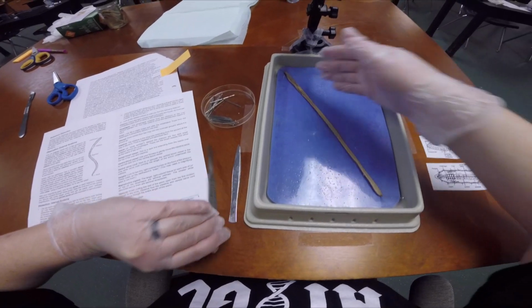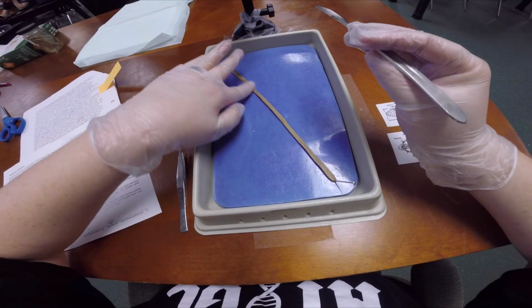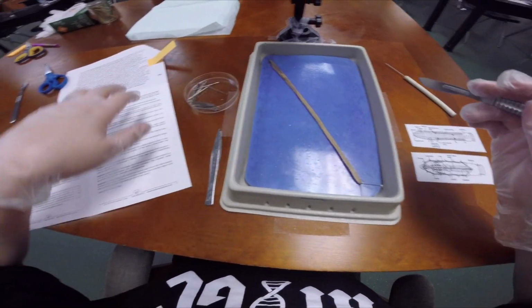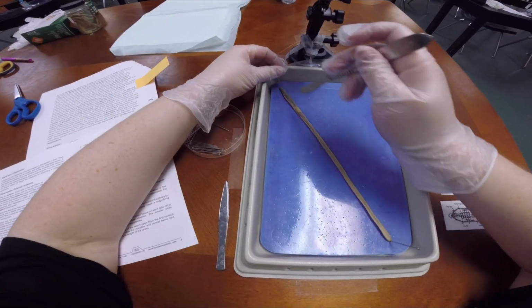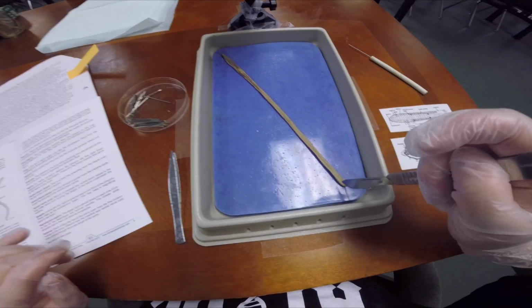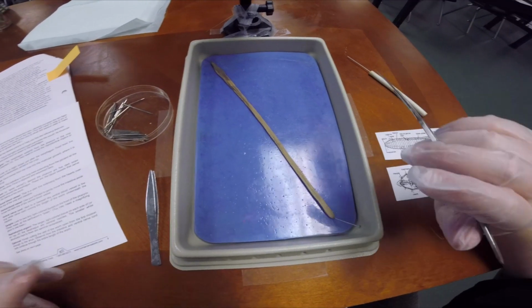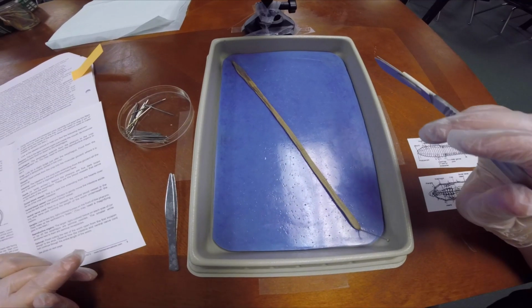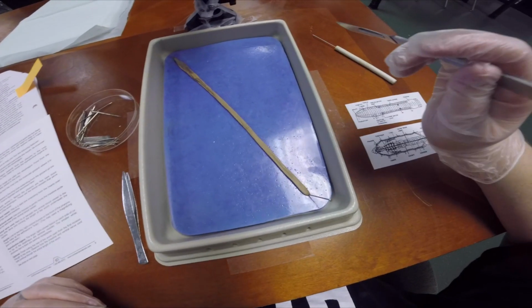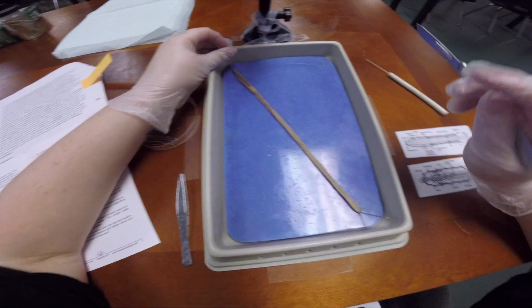Since he's taut, it'll make it easier for us to cut. We're going to cut from the first part of the pin down to the bottom, and when you cut, you want to make a straight line all the way down. These guys cut very easily. They cut like you would when you heat up a knife and run it through butter. So you want to be very careful and make sure that you don't cut any of the inside parts, because if you do, they're going to be much harder to identify.